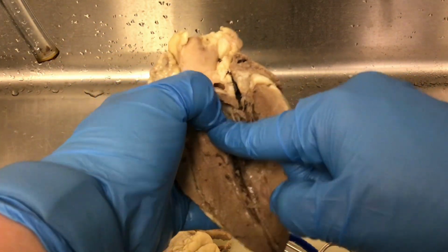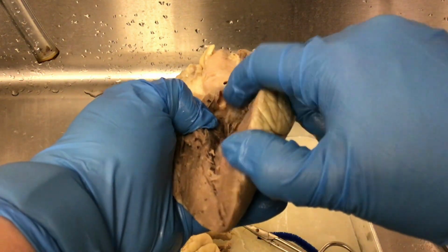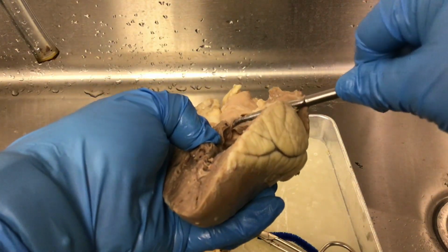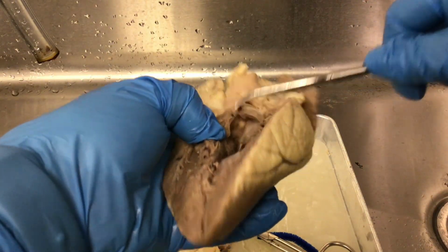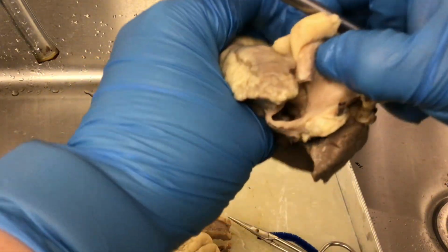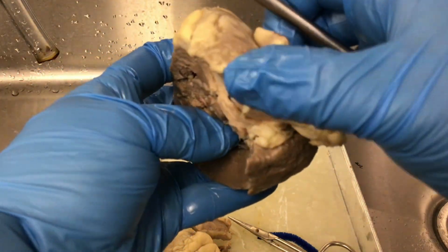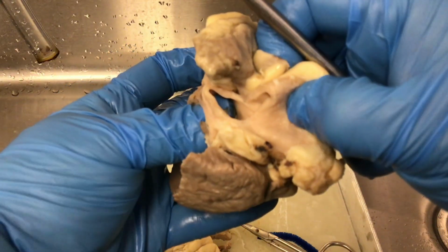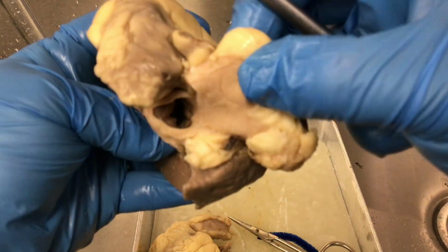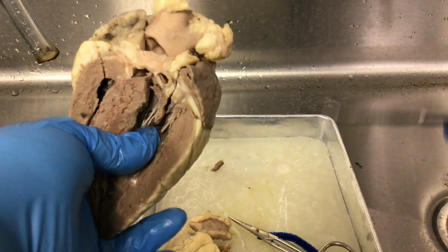And at the base of the aorta, and I did cut here, cut in a couple of ways, at the base of the aorta you would have the aortic semilunar valve. So you can see some pieces of it here. You can see where my probe is pulling. But then I also did a cross-section of the aorta. So this is the aorta. And you can look down into the valve, or into the base of the aorta. And so where my thumb is coming up, that is the aortic semilunar valve. The aortic semilunar valve. And then oxygenated blood would go to the body.